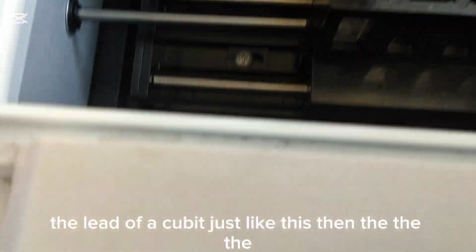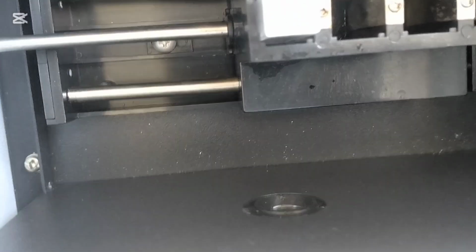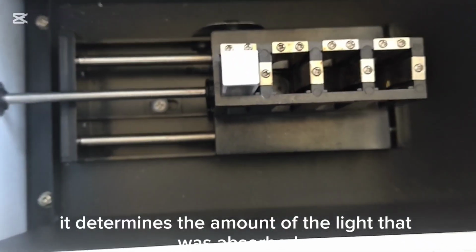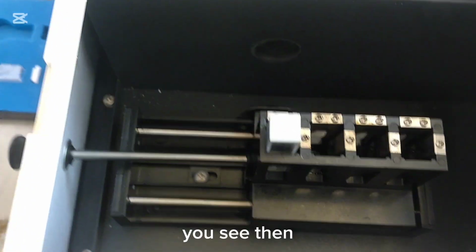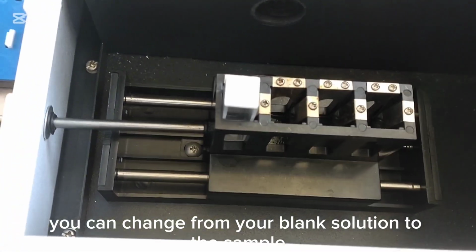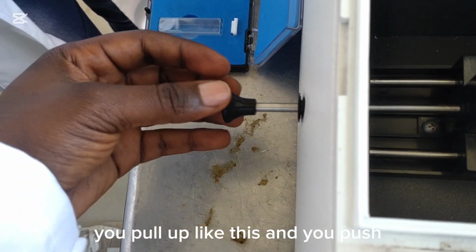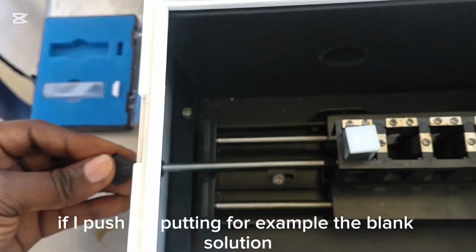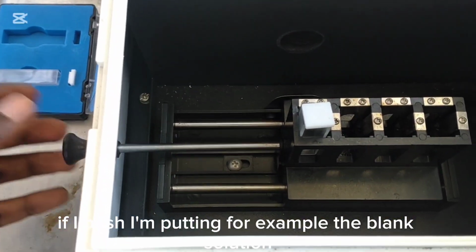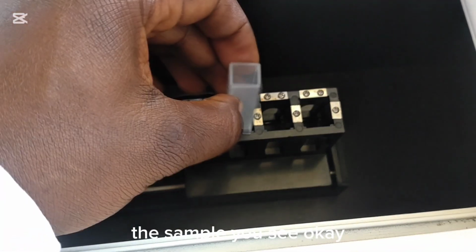Then there is another light here on this edge, to make sure that it determines the amount of light that was absorbed. You see, then you can change from your blank solution to the sample by just moving this gear. You pull up like this, and you push. If I push, I'm putting, for example, the blank solution, then the second cuvette can be filled with the sample.